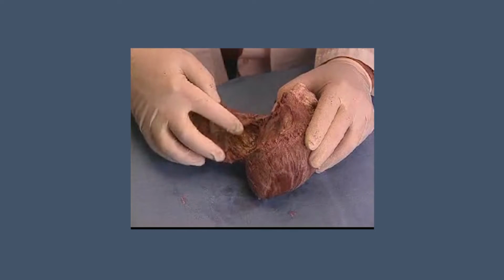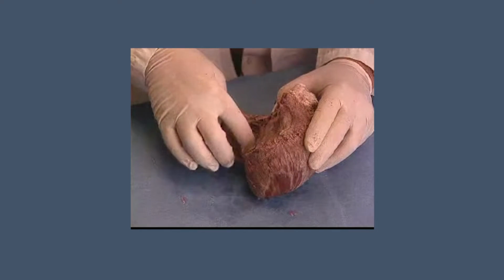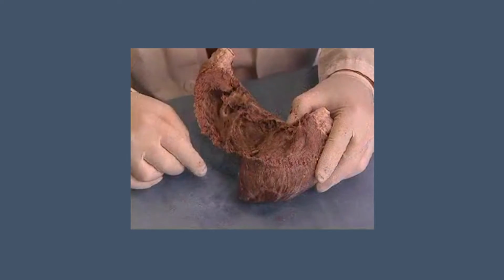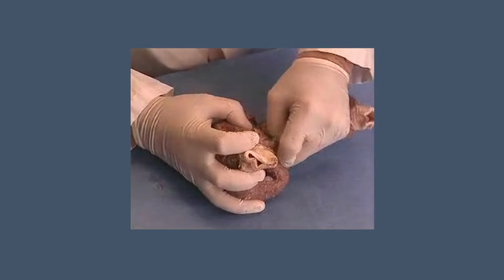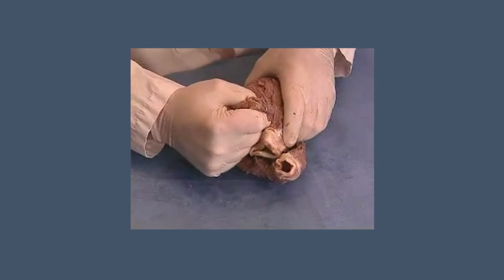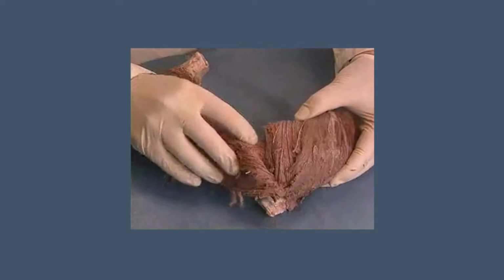A second anatomical fact to observe is represented by the posterior limit of the right ventricular cavity, where the free wall and septum meet. Here begins a cleavage plane that must be followed all the way to the root of the aorta. At this point, you can see, once again following the direction of the fibers, how they descend into the well of the left ventricle.